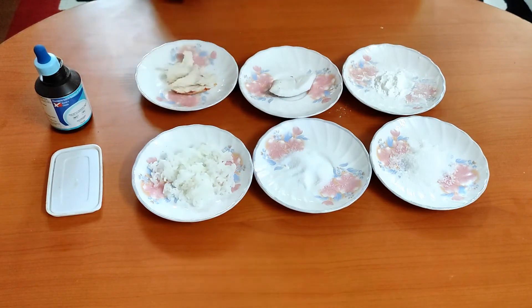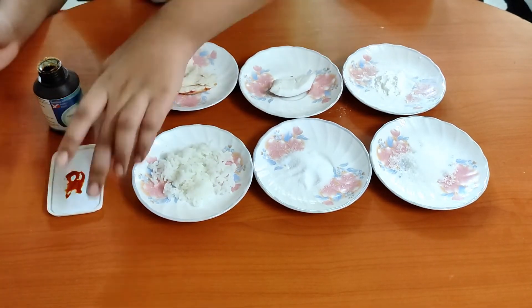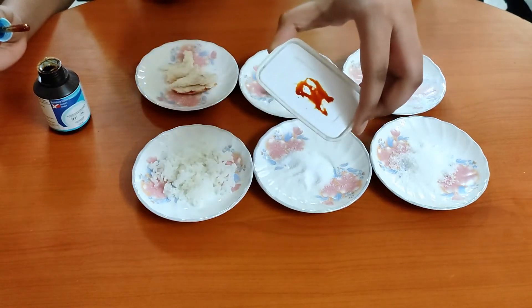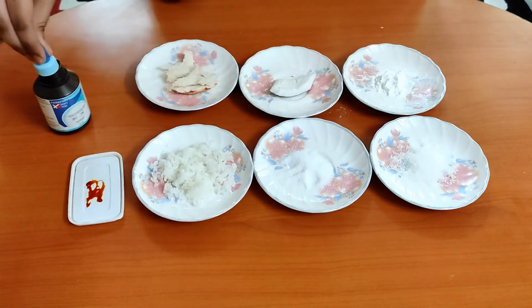First we will show the color of iodine. As you can see, it is reddish brown in color. Now we will put a few drops of iodine on these food items.